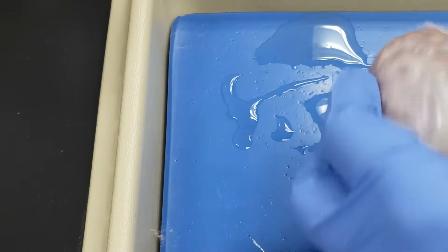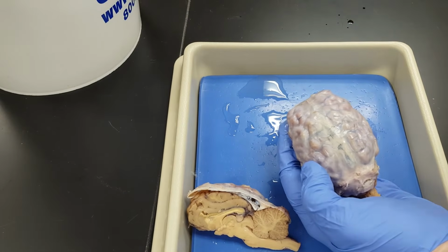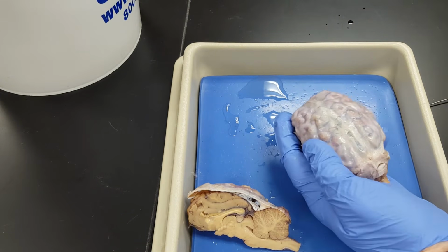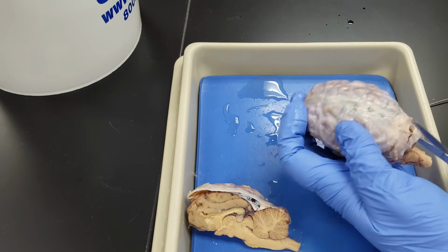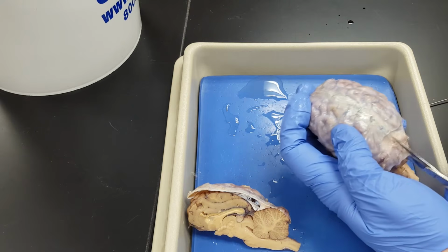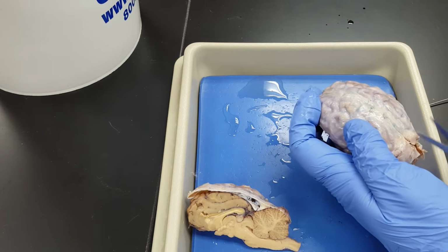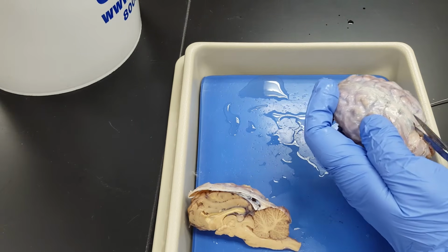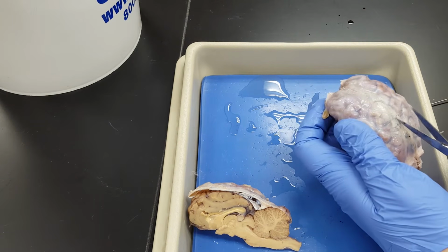What I need to do is take this brain right here, and I will remove the dura mater for you, which takes a little bit of dissection, but I'm not above doing a little bit of dissection. Trying to cut this thing right down the longitudinal fissure or thereabouts, because that's a fairly easy thing to find externally.